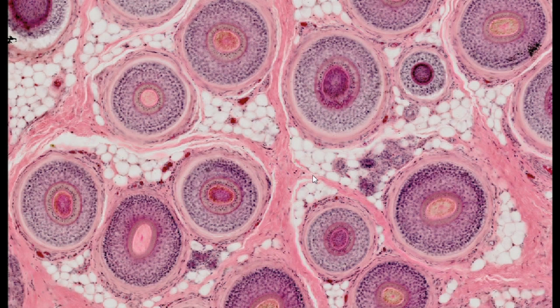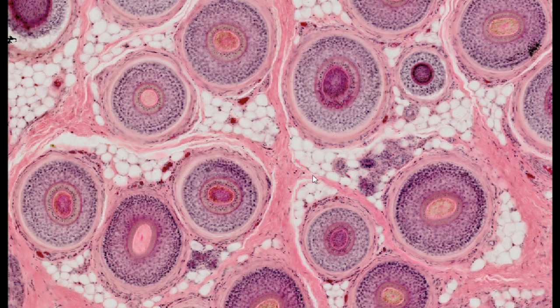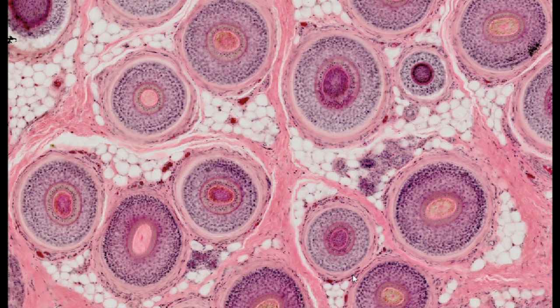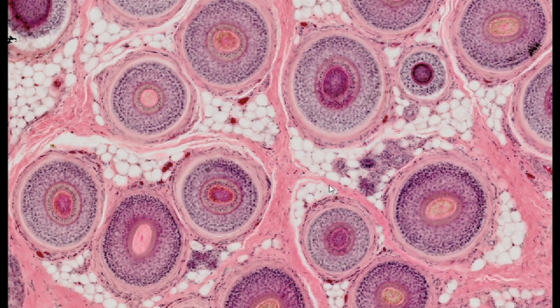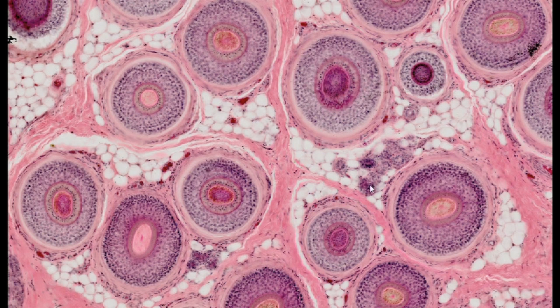The presented type of connective tissue, which is an effective thermal insulator, also protects against mechanical trauma and is involved in the storage of nutrients. The cross section shows hair follicles with lobules of yellow adipose tissue located in between.